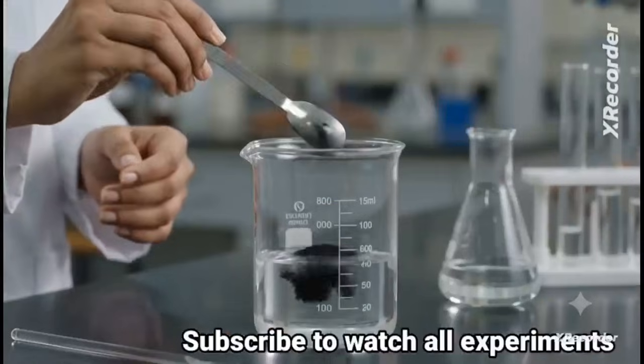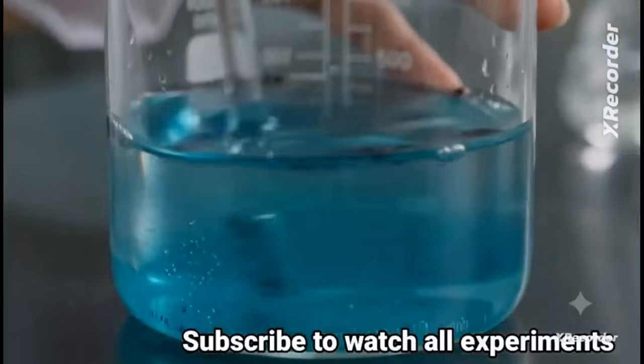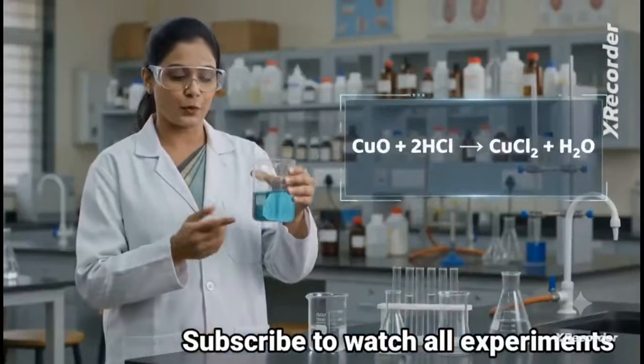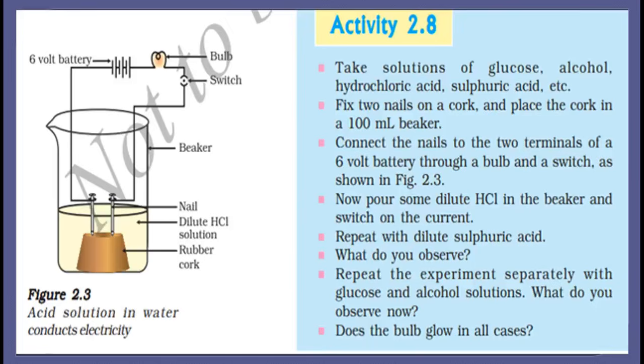Let's react black copper oxide with acid. Add hydrochloric acid and stir it well. It turns blue-green, forming copper chloride. Here is the balanced chemical equation. This proves metallic oxides are basic.